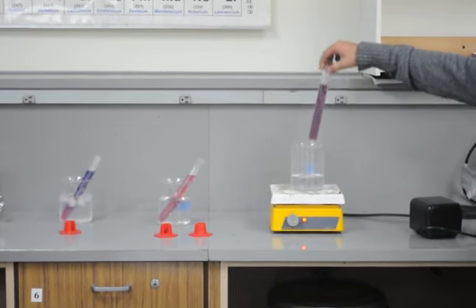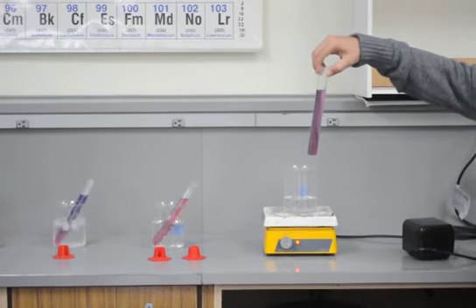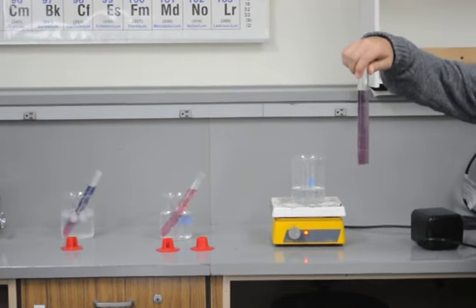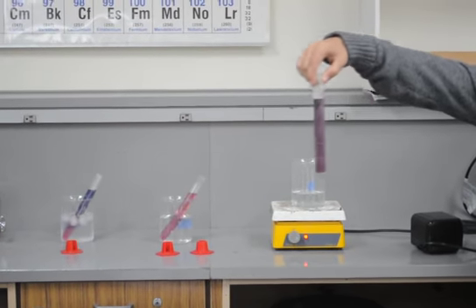That's a hottie. We're getting that change again, aren't we? Going back to the bluer color.